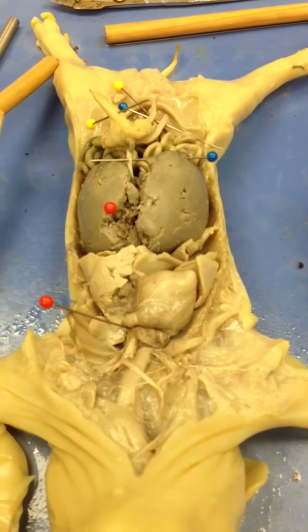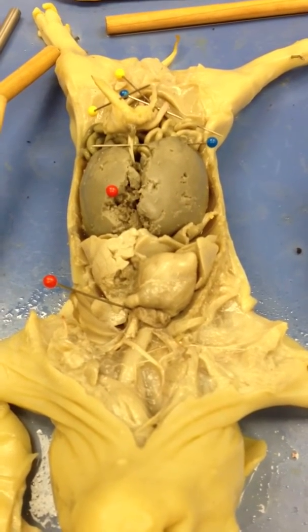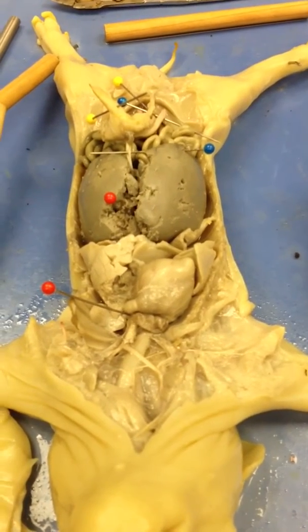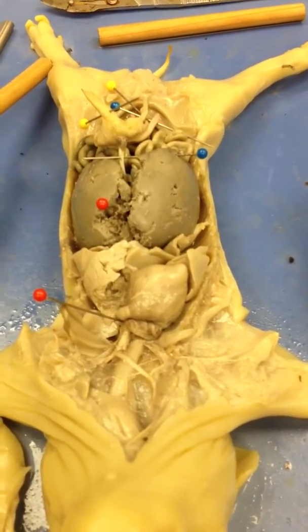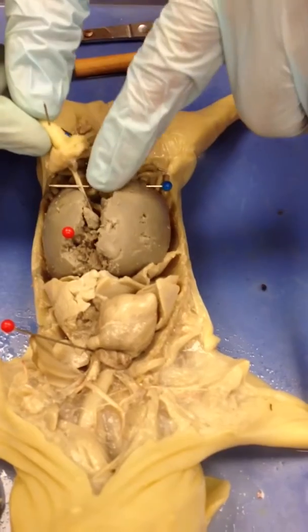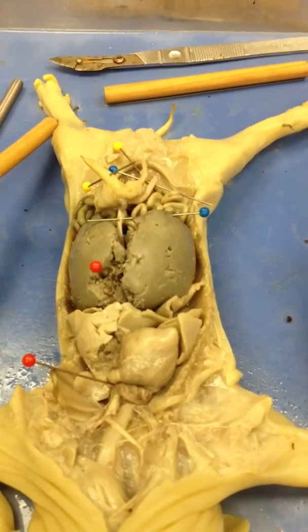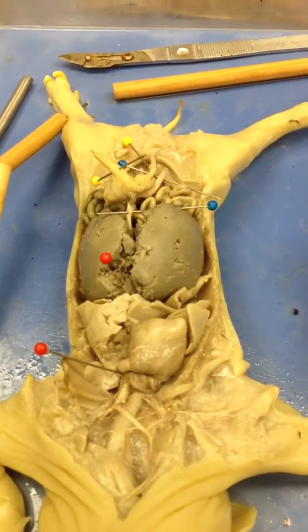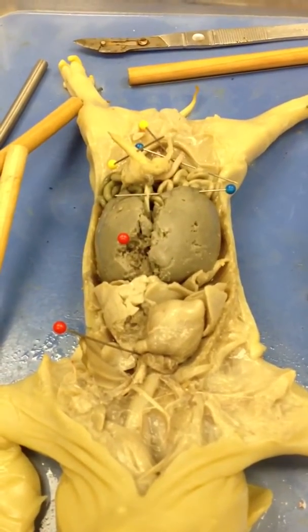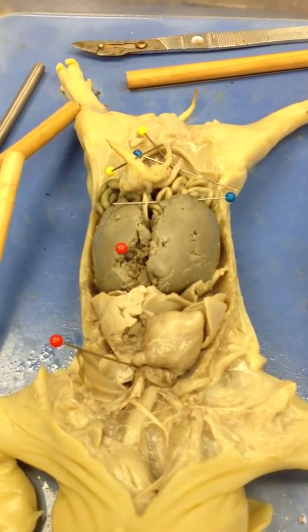So the whole purpose of this is fetal circulation, which is kind of what we were talking about before with the cat. After this pig is born, these things disappear. What's going on here is it's getting blood from the mother that's already nutrient rich and oxygenated. So it's coming in through the umbilical cord, going up through the umbilical vein into the liver, and it gets connected into the circulatory system of the fetal pig at the ductus venosus right here, which is also bypassing the liver at that point.